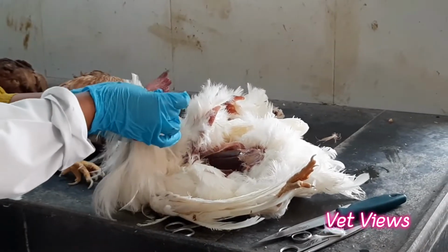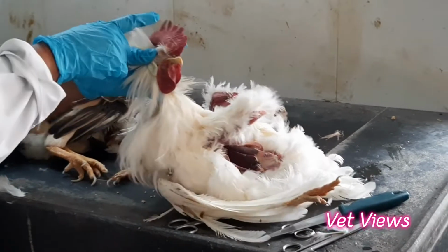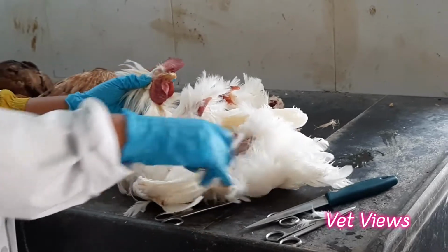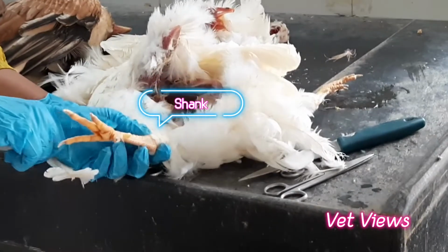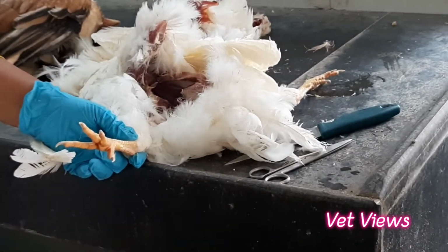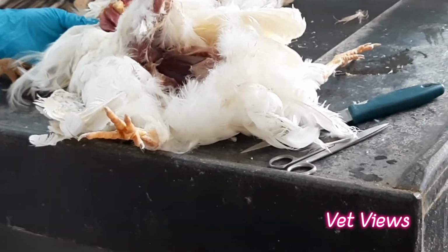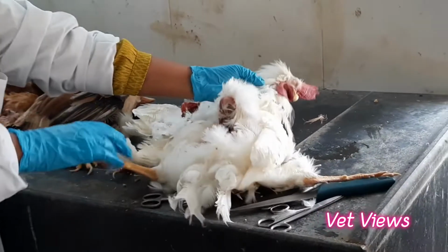When there is severe cyanosis of the comb, you can suspect Newcastle disease or bird flu also. In bird flu you have to see two portions mainly. One is the comb, where there will be severe cyanosis, a dark, bluish color, and also you have to see the shanks. There will be hemorrhages just below the skin, so there will be bluish discoloration here. These two are very good indications, even at the flock level, if you go and see the comb and shank. These two are very clear indicators for bird flu cases. And this is for external examination.